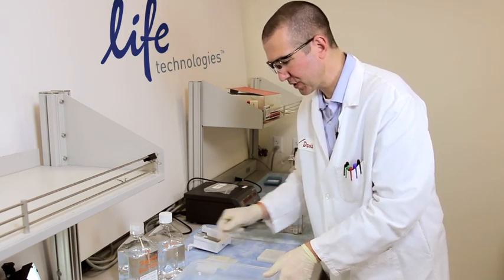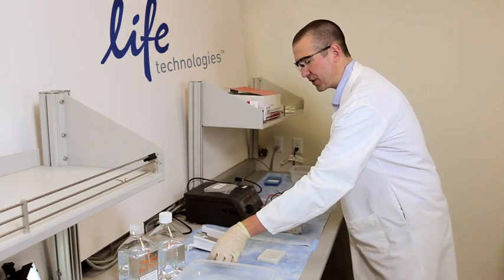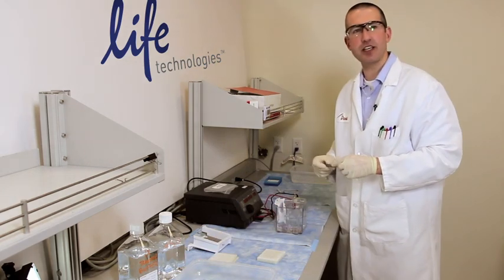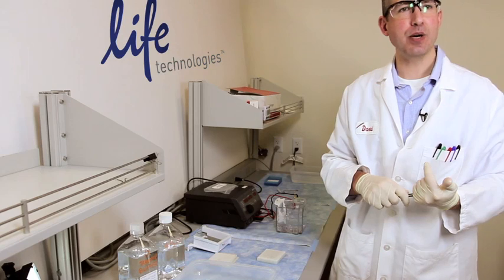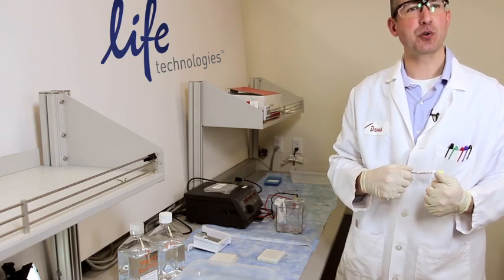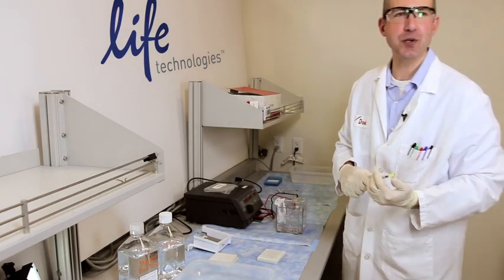And once the block procedure is complete, we can move that blot directly into primary antibody, wash, secondary antibody, and then complete with our detection method of choice. And that's it for a wet transfer.